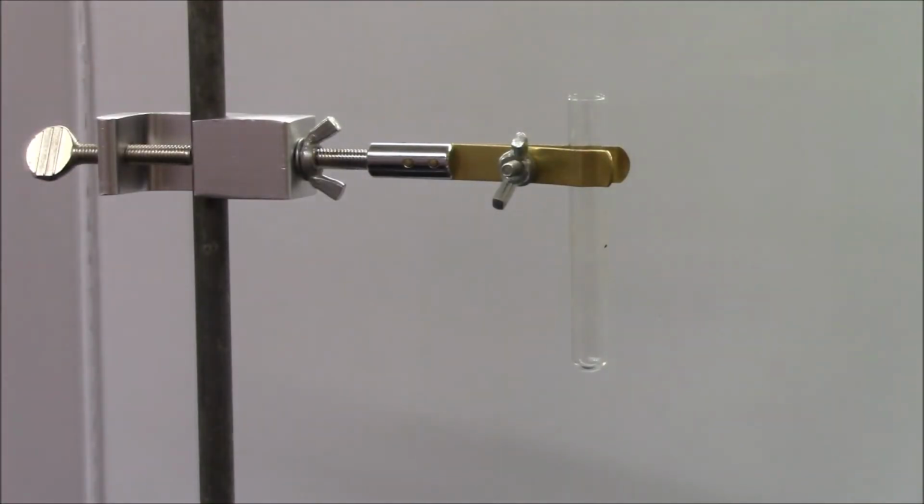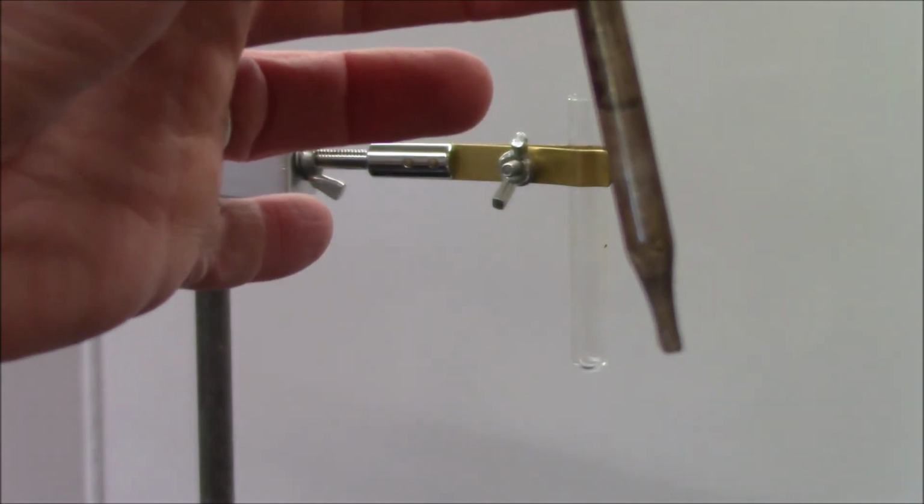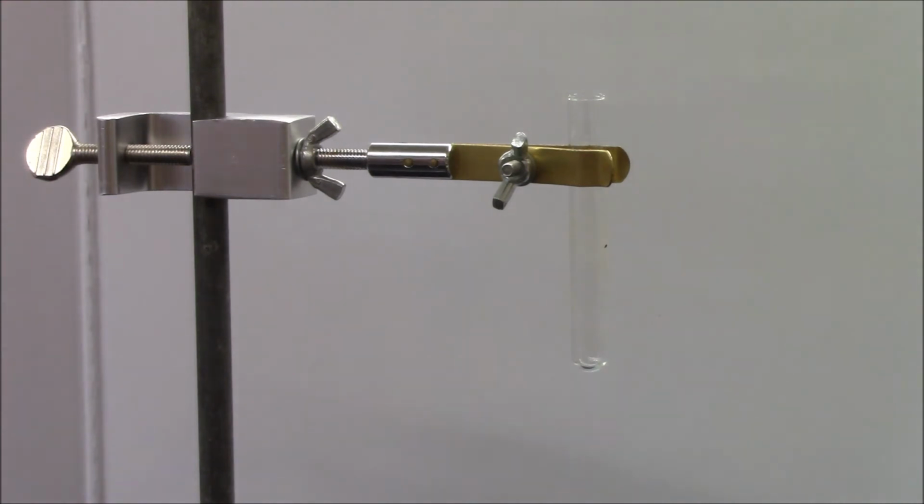On our next reaction, we are mixing silver nitrate. Again, I'm using a different kind of dropper here. It might actually be hard to see because this dropper is dirty, but I'll hold it up anyway. Okay, so this solution is also colorless and transparent.